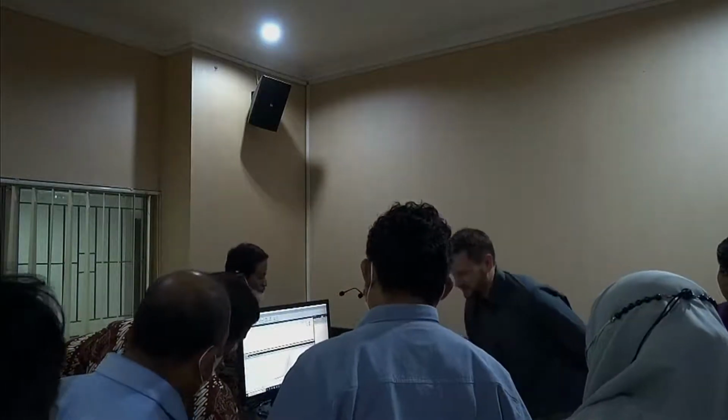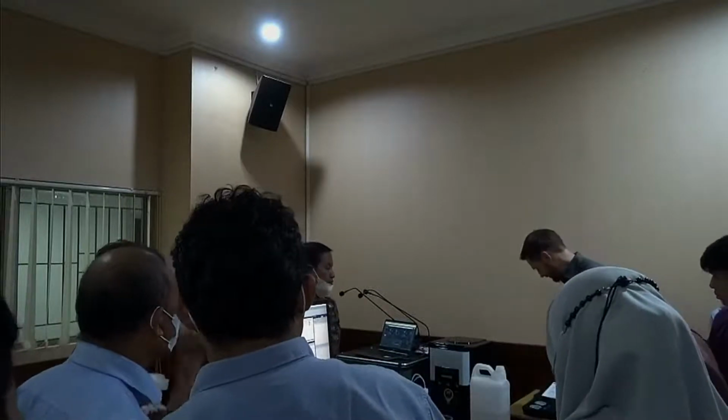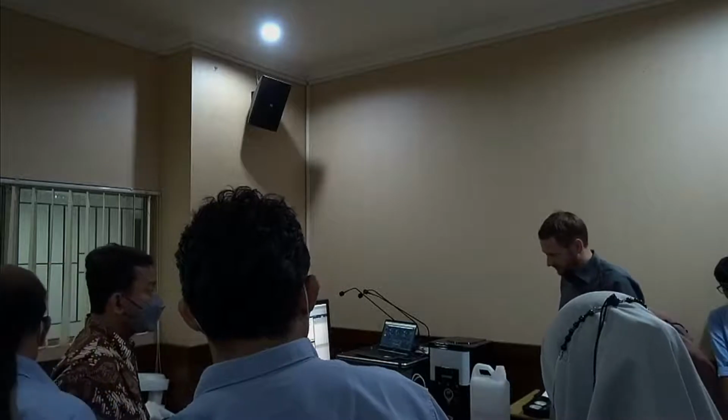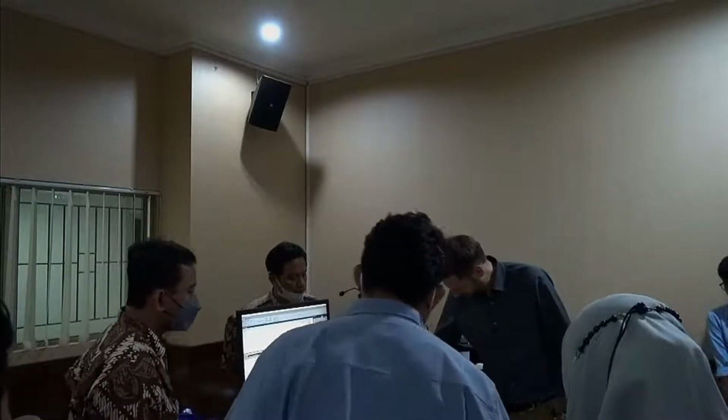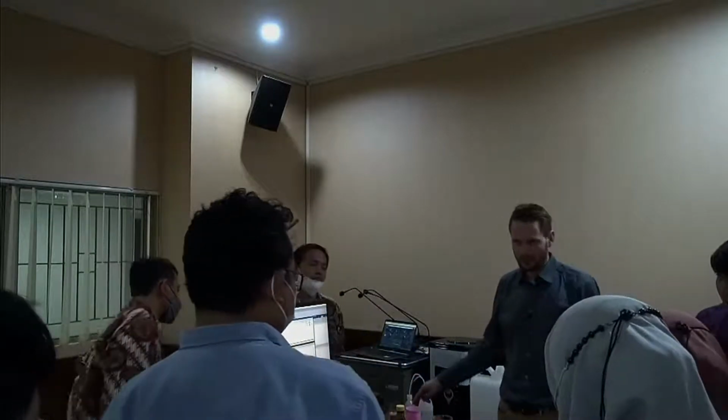Okay, F500 comes in pretty nicely. We created a dispersion with this, put it away, and move to the next sample. So what we have here is an organic example. We just bought some coconut milk.